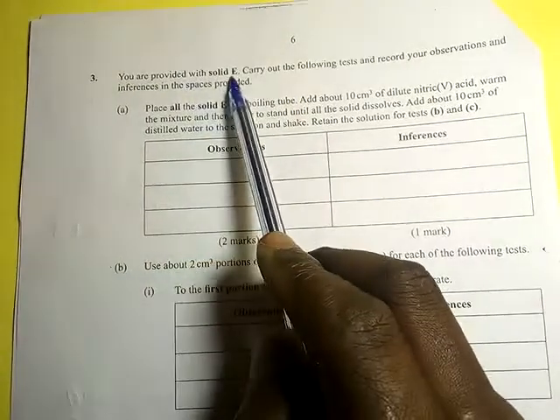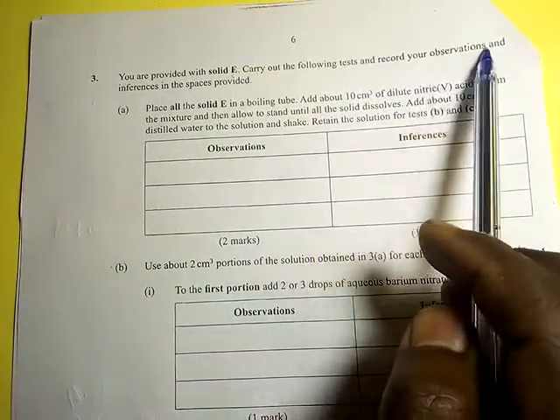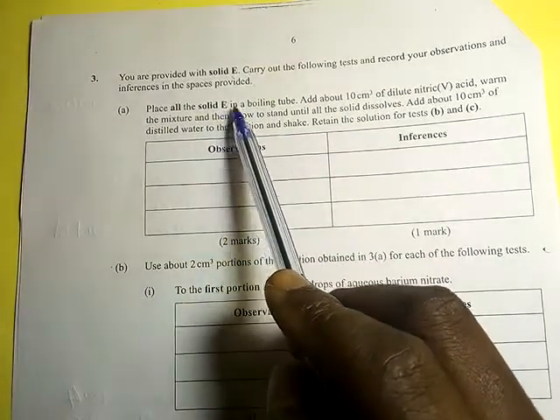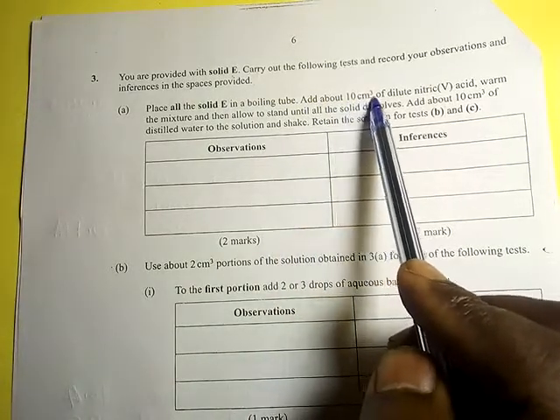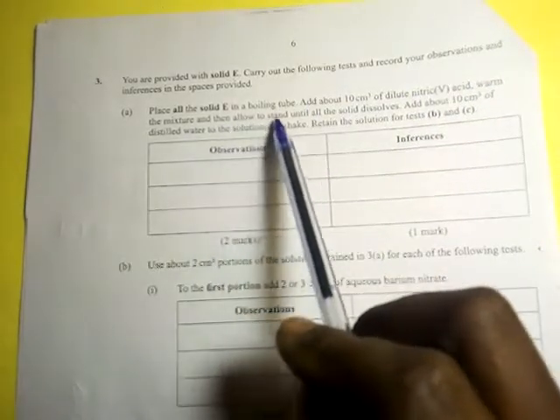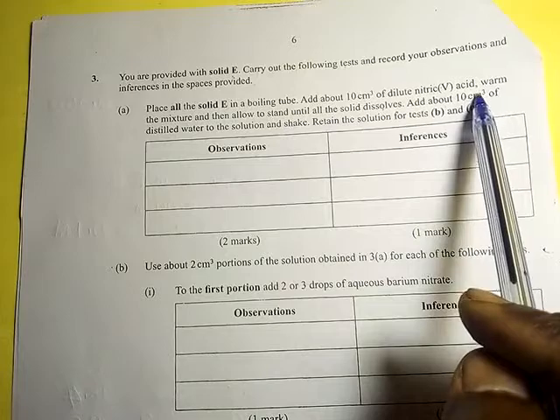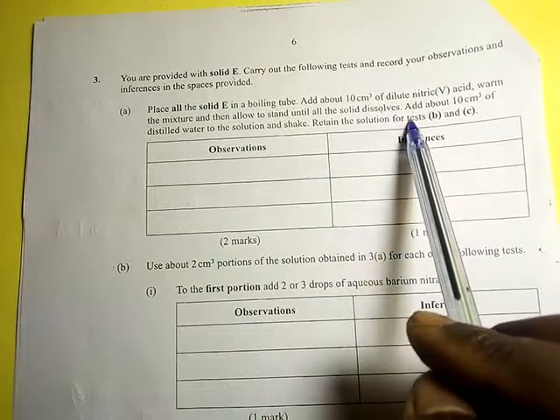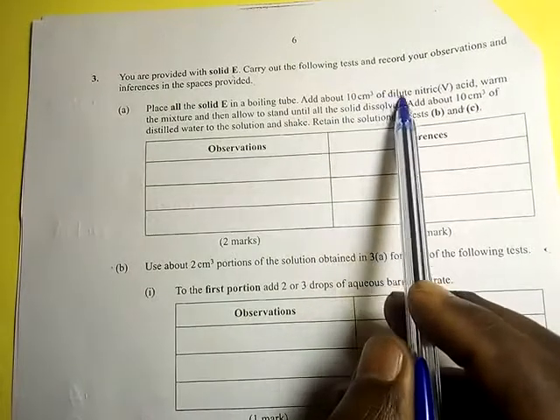You are provided with solid E. Carry out the following tests and record the observations and inferences in the spaces provided. Place all of solid E in a boiling tube, add about 10 cm³ of dilute nitric acid, warm the mixture, and then allow it to stand until all the solid dissolves. Add about 10 cm³ of distilled water to the solution and shake. Retain the solution for tests B and C.